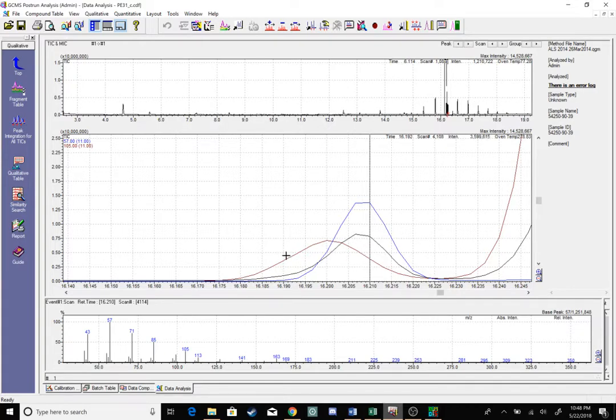Another way to visualize this: if I select on the left-hand side of my peak in black, I can tell 105 is my primary ion there, but as I move to the right, 57 creeps in and then overtakes my 105 mass fragment later on in that same peak.